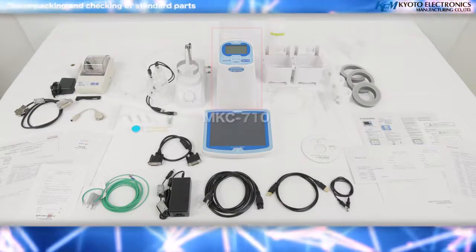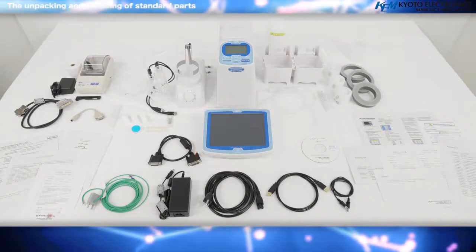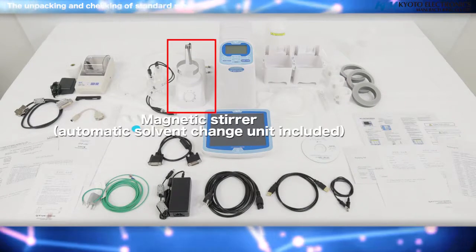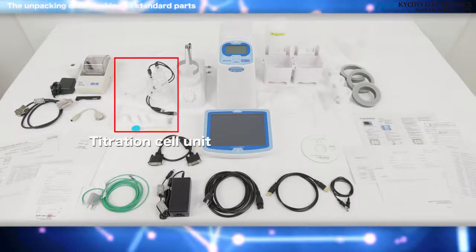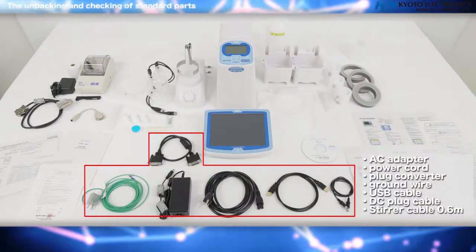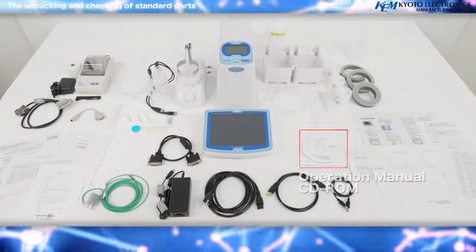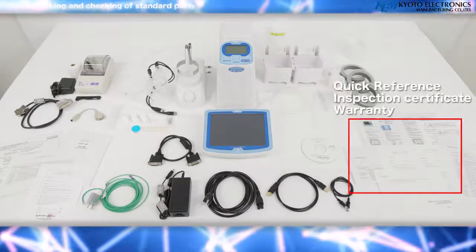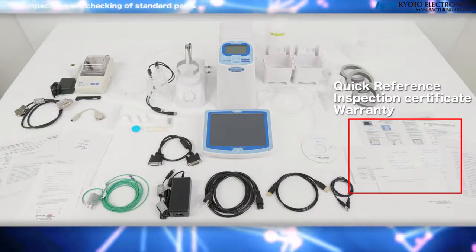MKC710 main unit. MCU710M magnetic stirrer, automatic solvent change unit included. Automatic solvent change unit. Titration cell unit. AC adapter, power cord, USB cable, DC plug cable. Operational manual, CD-ROM. MKC710 Quick Reference. Inspection certificate, warranty.